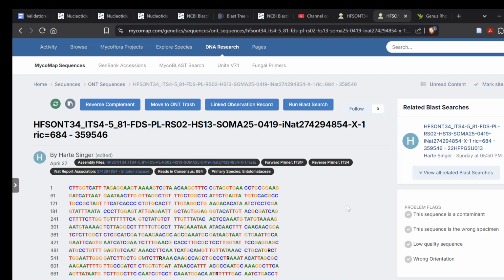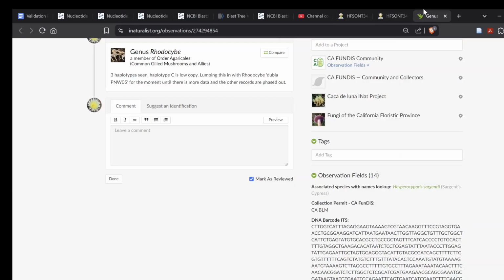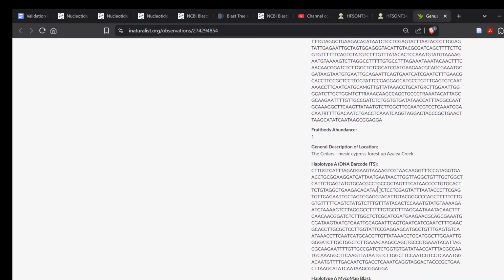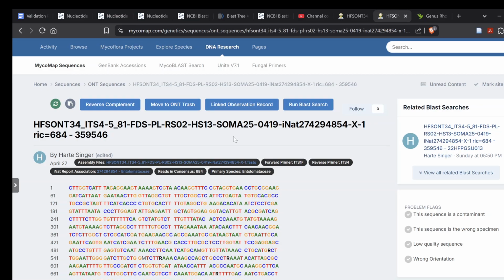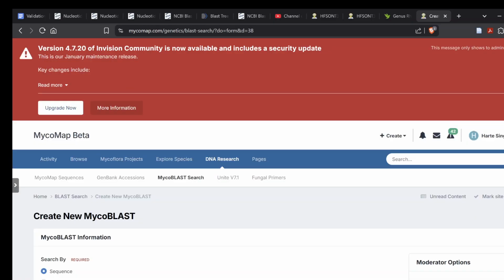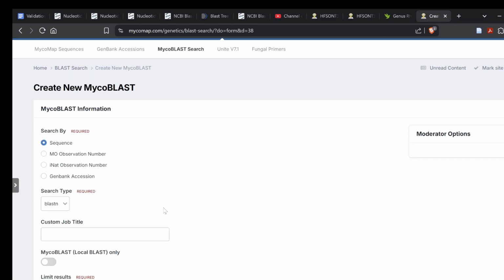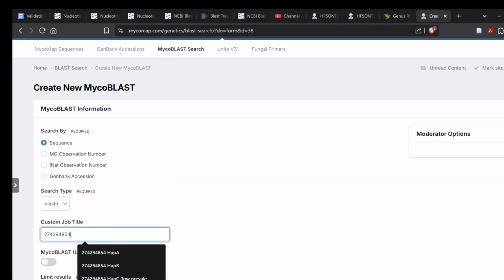So the more matches you have, the further down you can see things that match. So you'll do that, and then you're going to add just in iNaturalist your haplotype A, and you'll go to MycoBLAST search, and you'll add a new BLAST, and you'll make the custom title the iNaturalist number. You can just say Hap A.